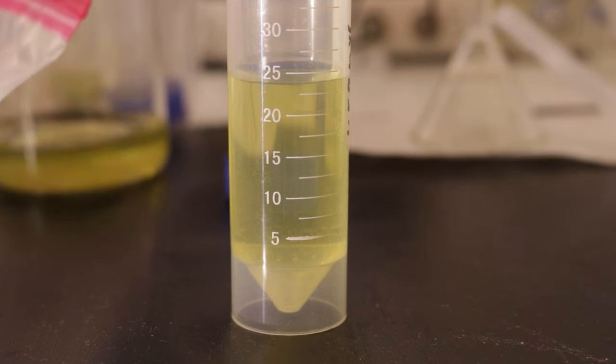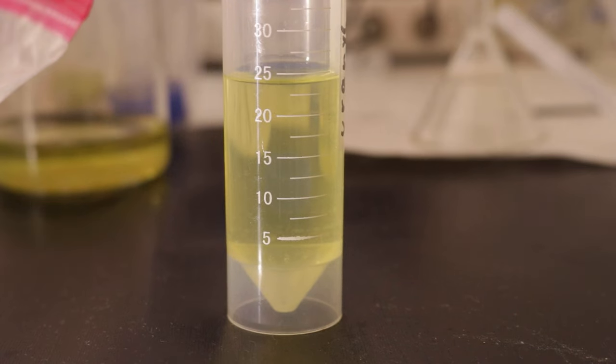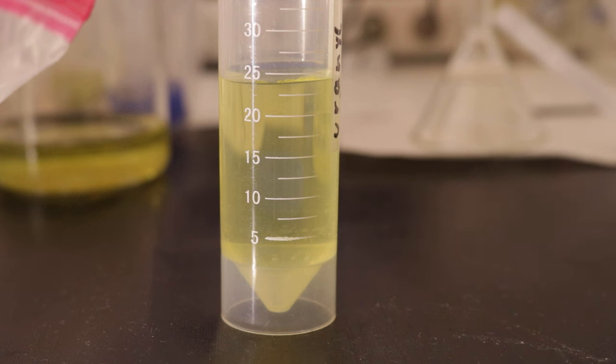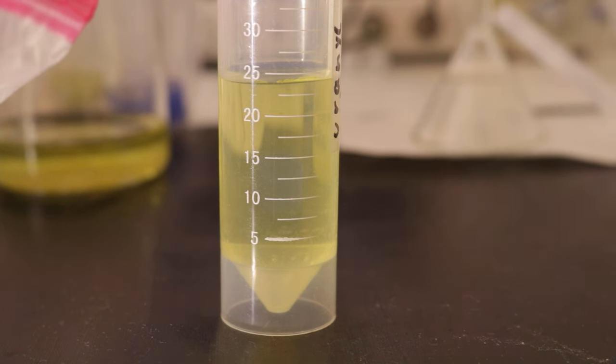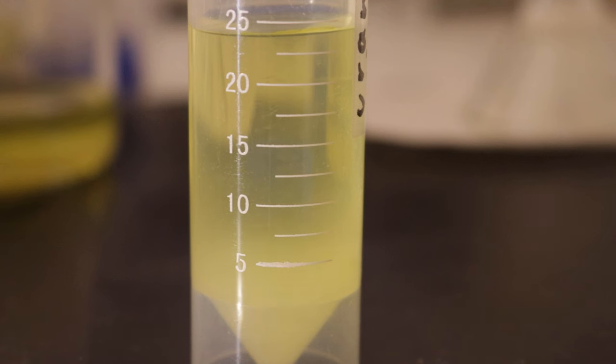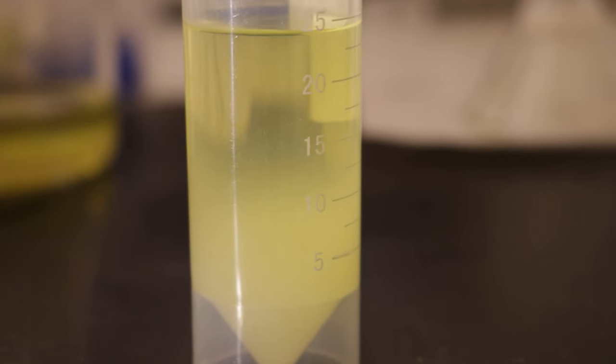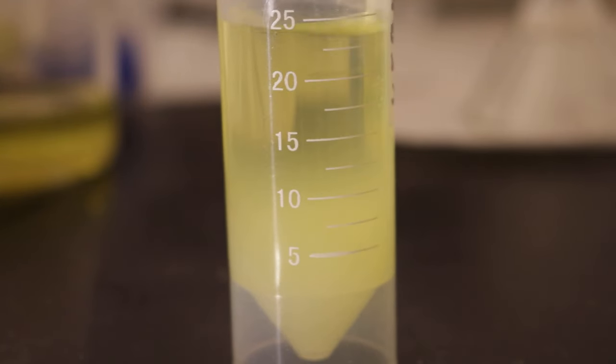I'm not sure if it's uranium, the uranium being radioactive or the precipitate. Let's add some sulfuric acid and see if we can see anything in the solution. I think no precipitate is forming anymore, but it is very obvious that we precipitated out something. That's very good. Let's just settle out and then see if we can extract that.